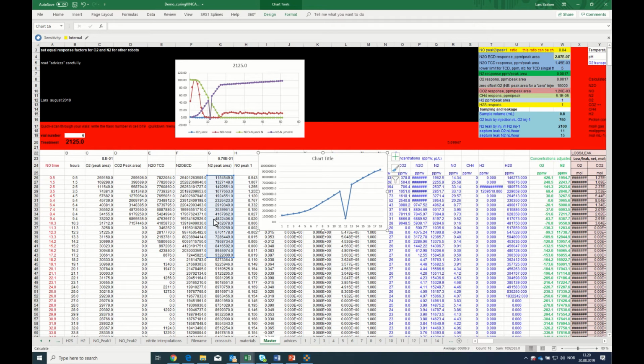So what happened here was that the needle was clogged by rubber. That happens from time to time. You may also have similar problems if you have an integration problem, although it's an automatic system which should function the same way all the time. Sometimes you get errors. You might try to fix it by reintegrating your peaks, but if it is due to a clogged needle and you lost the measurement, you have to do something about it.